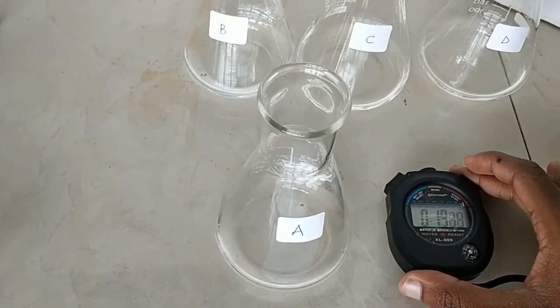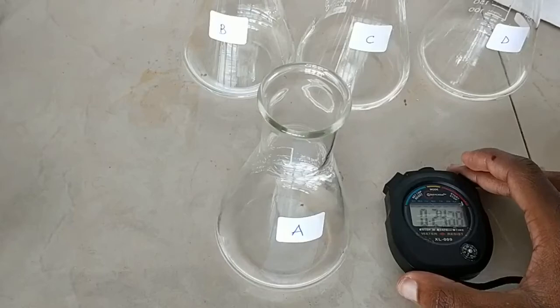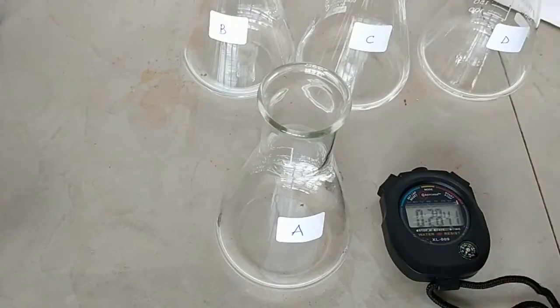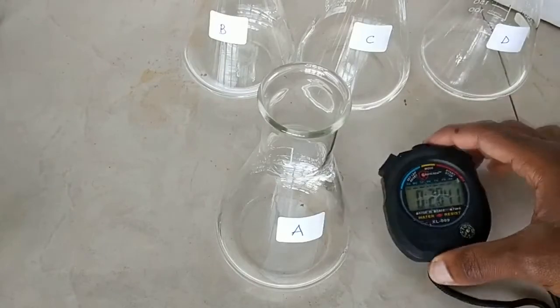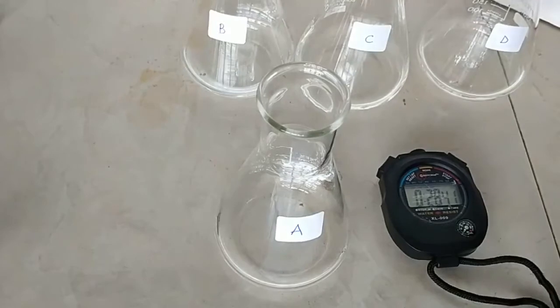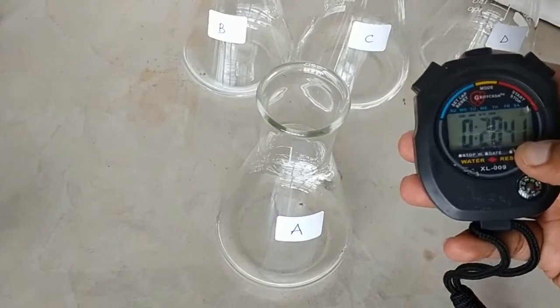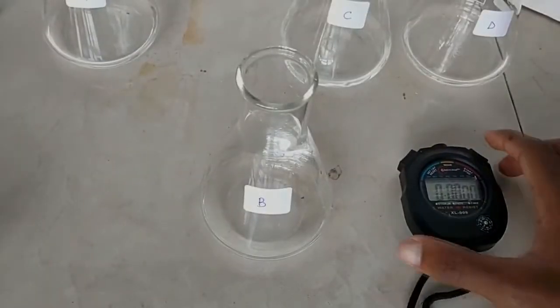You can see the effervescence — that is because magnesium reacts with sulfuric acid to produce hydrogen gas. The first reaction ended in 28 seconds. I'm going to record this in my data book. One thing many students confuse is recording the milliseconds — you don't need to record those; we are only interested in the seconds.